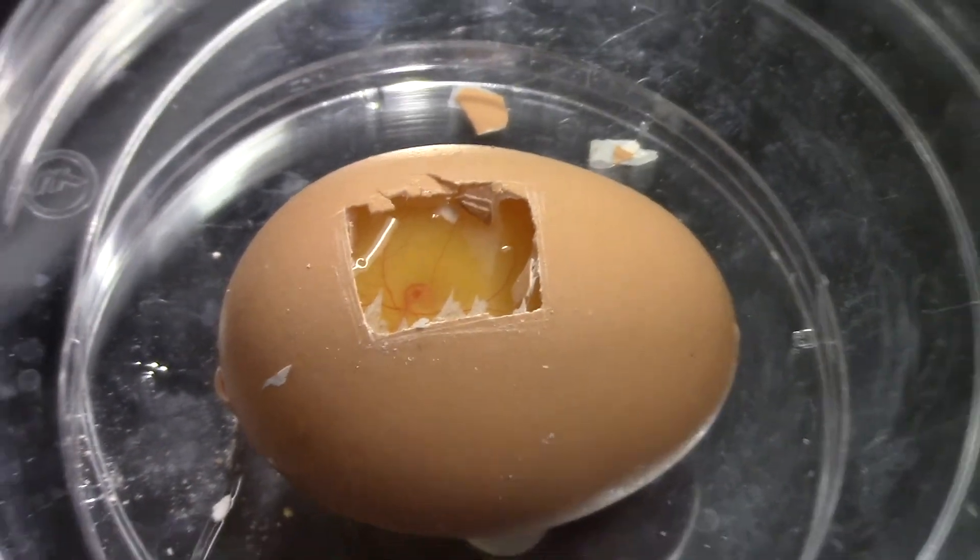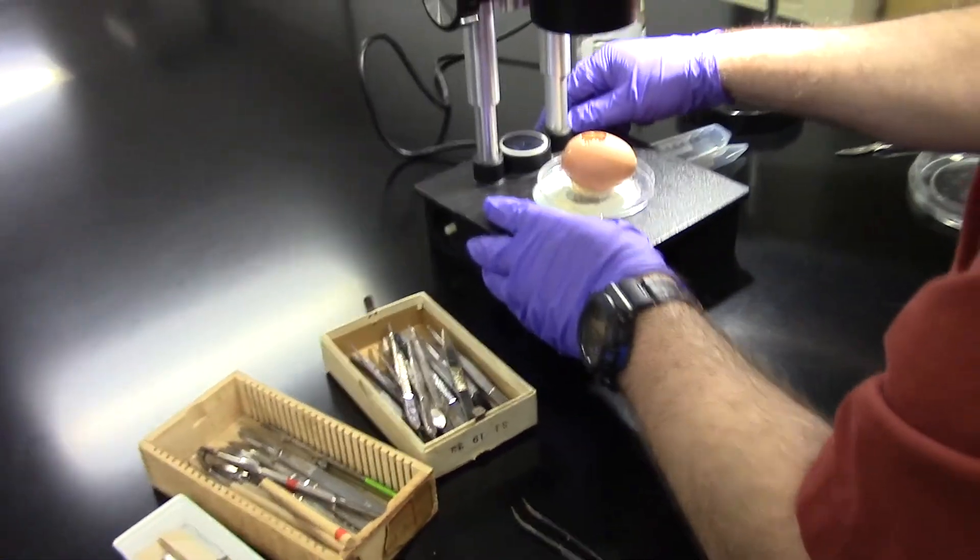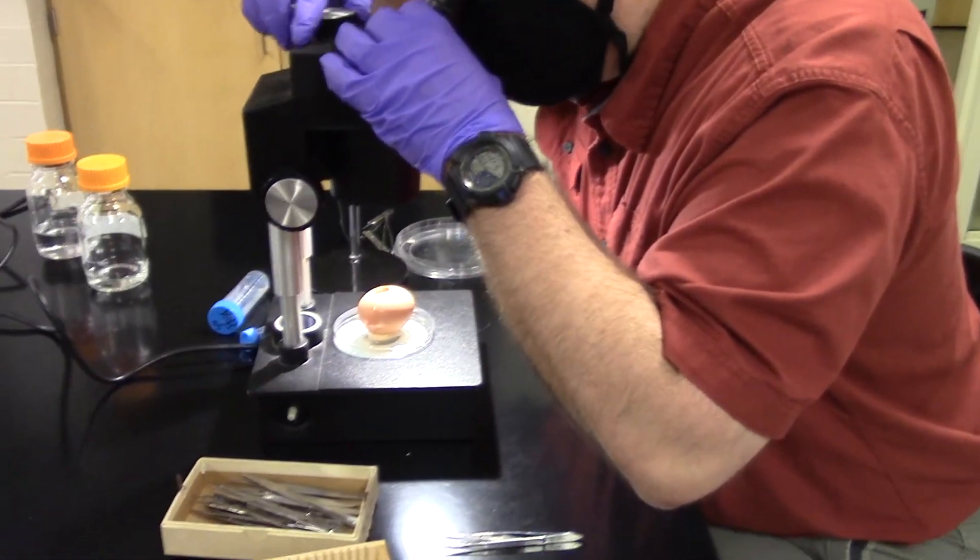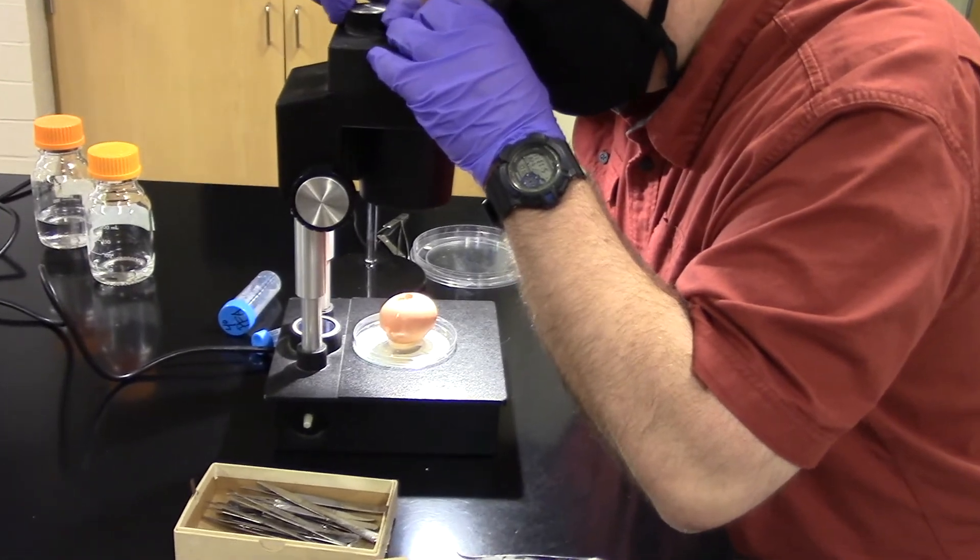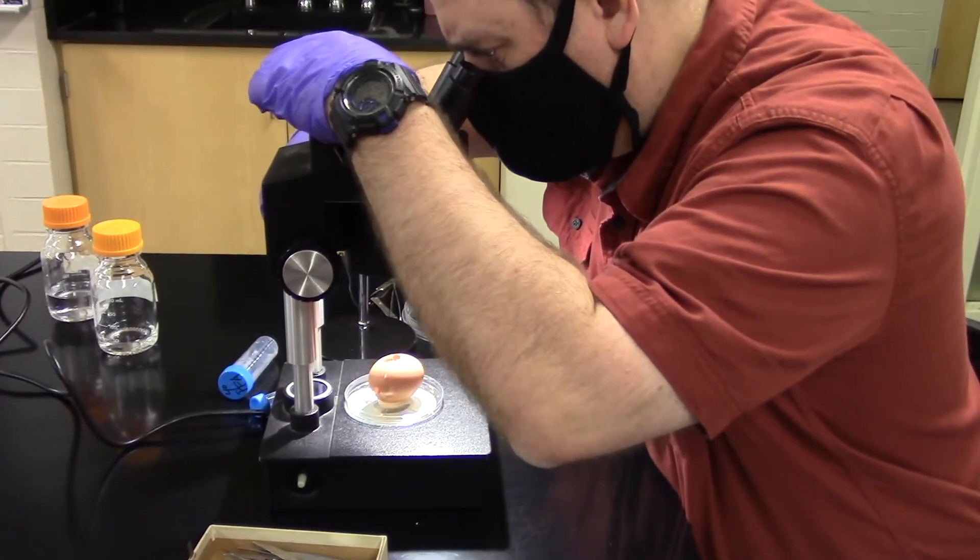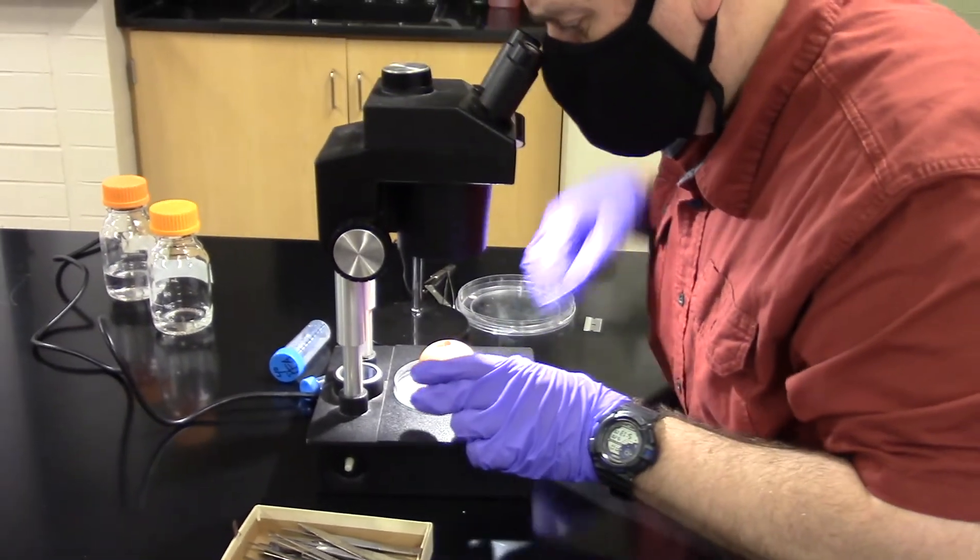Let's put this under the microscope and see if you can see it. This is called a dissecting microscope. It is designed so that you can put very large specimens on the microscope and still focus on them. I'd love you to see this beating heart.